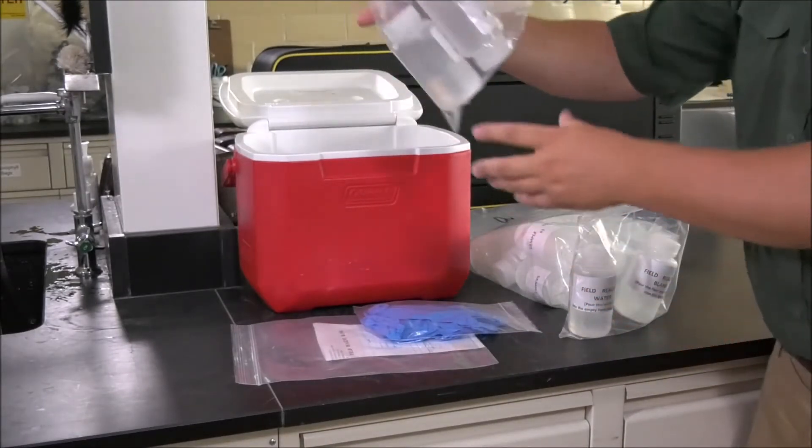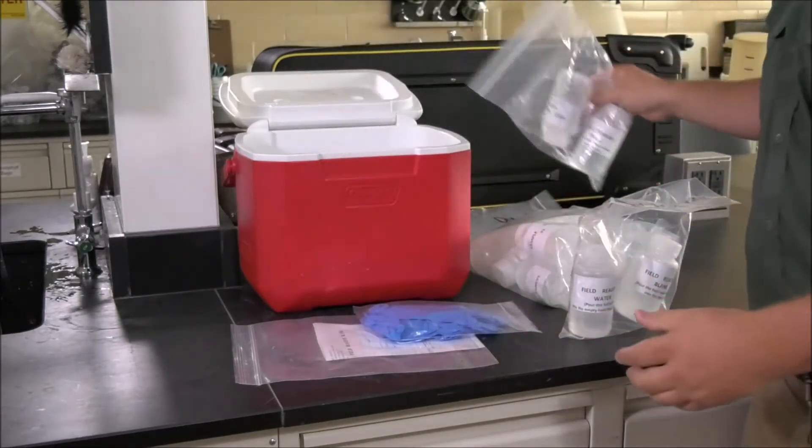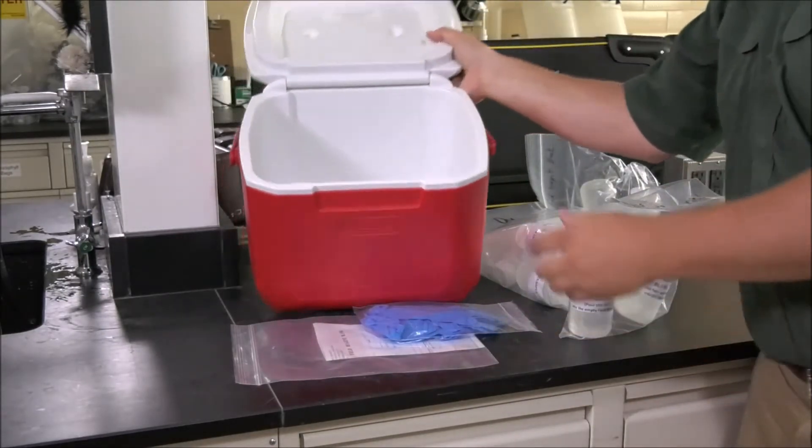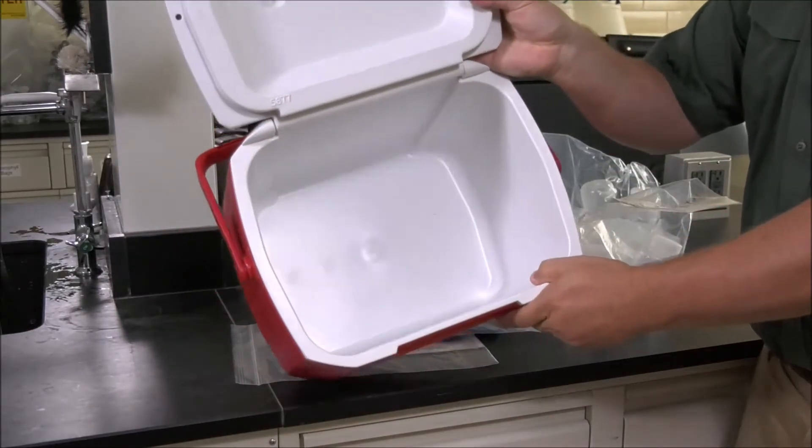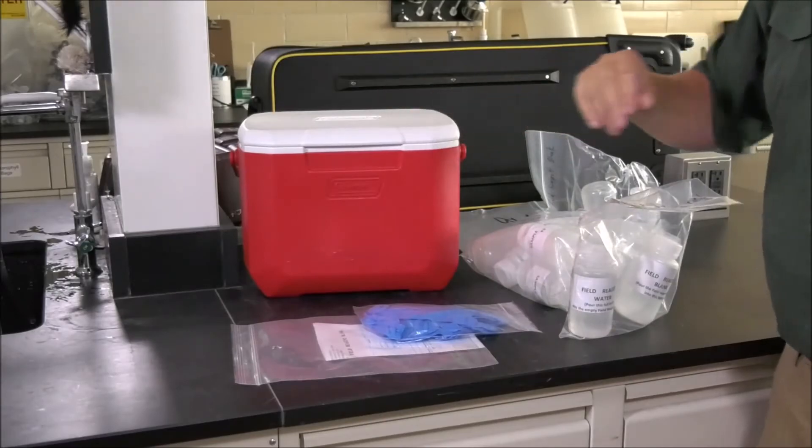A second resealable plastic bag containing a second set of field blank bottles, and a prepaid mailing label which is not shown. If you are missing any item, please call the EPD lab.